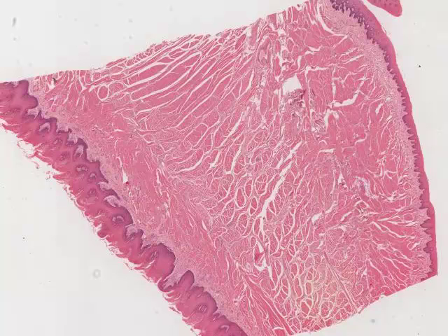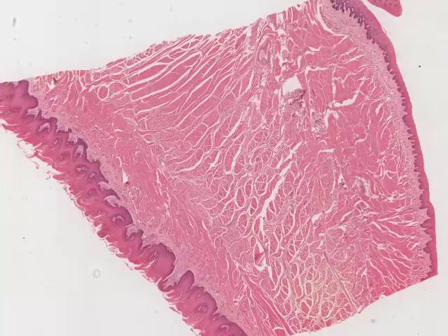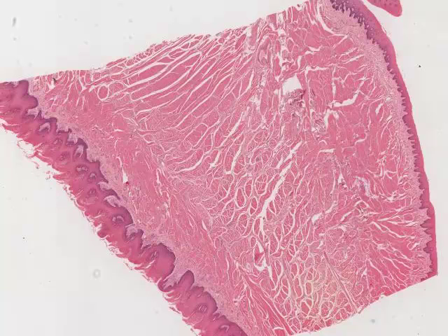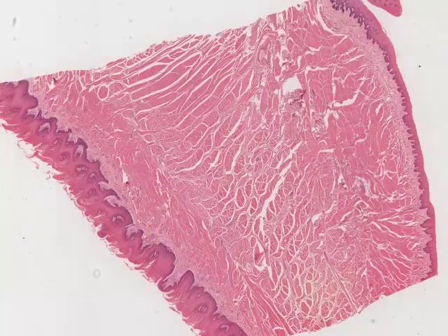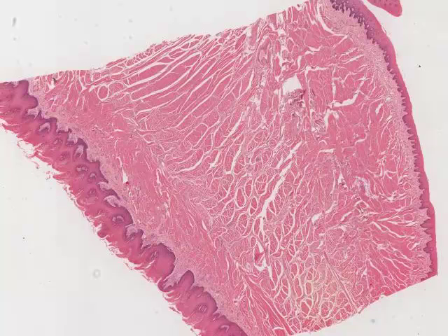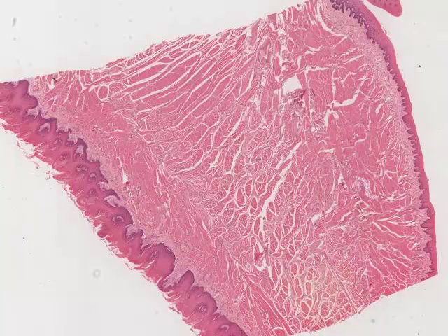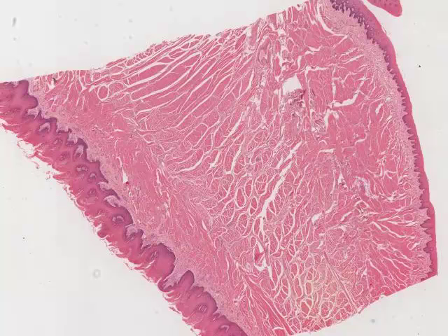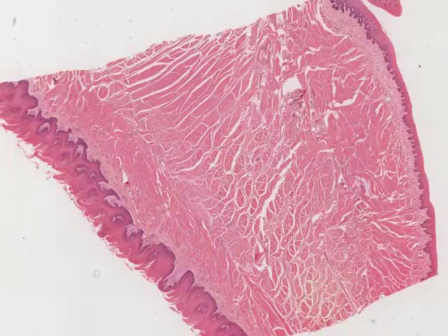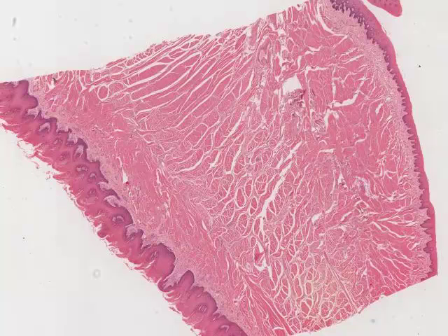We've already looked at muscle and nerve as they appear when they're isolated and the individual tissues are sectioned and put on a slide. But the real value in being able to identify muscle and nerve is in being able to identify them in the context of the other tissues in which they are found.